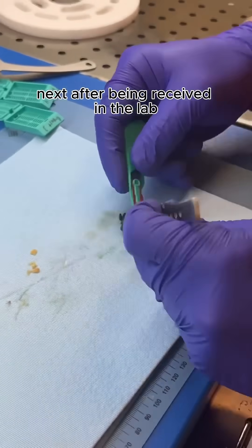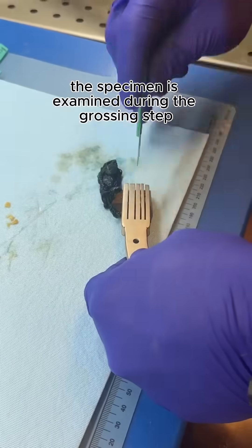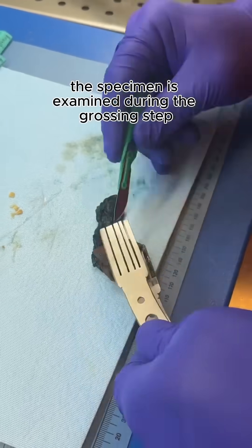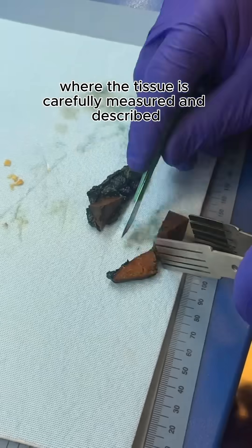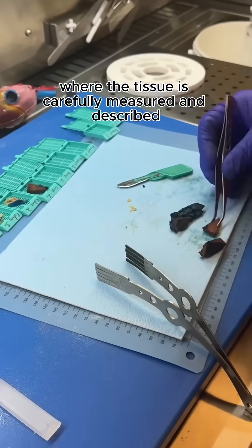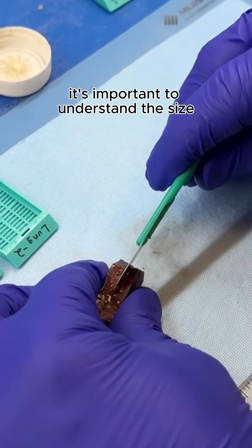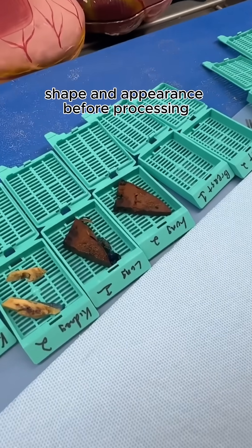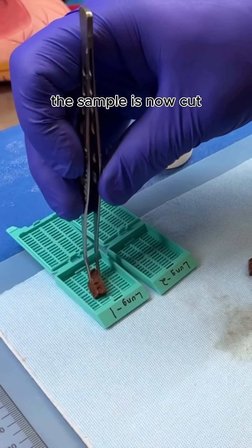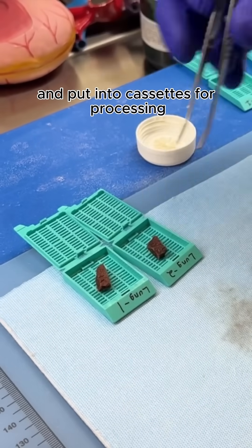Next, after being received in the lab, the specimen is examined during the grossing step where the tissue is carefully measured and described. It's important to understand the size, shape, and appearance before processing. The sample is then cut and put into cassettes for processing.